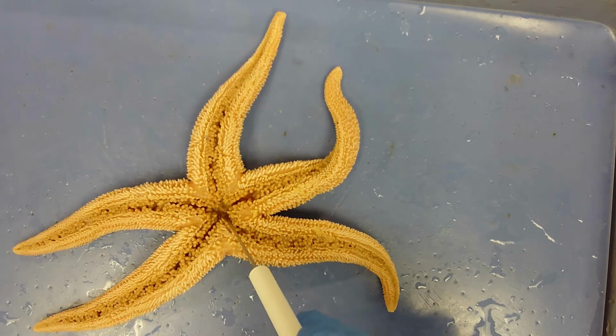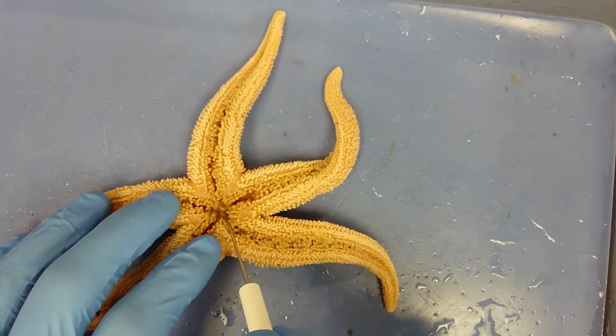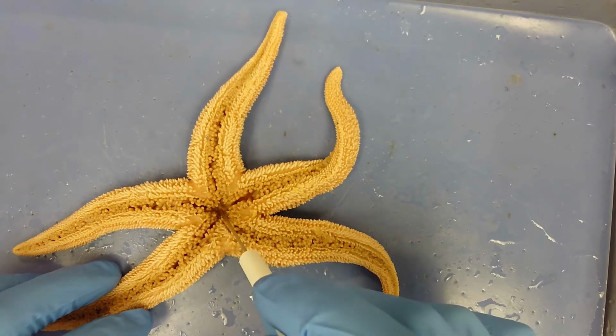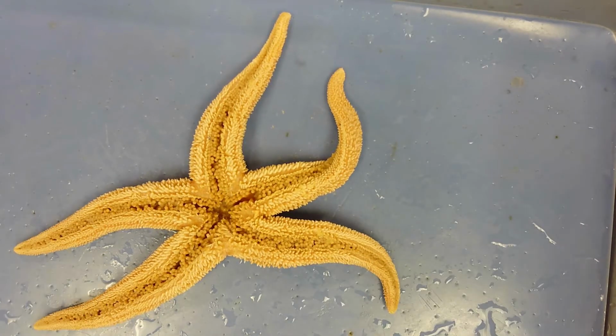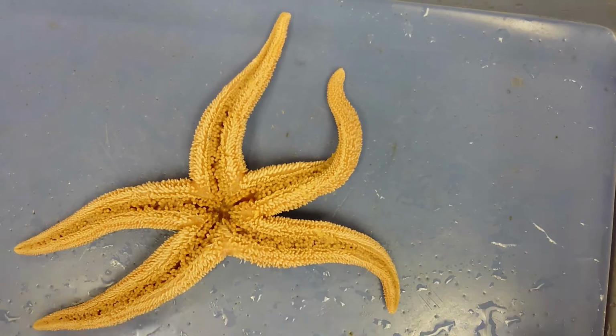This mouth is centrally located, right where all these arms connect, and all food items are going to be entering the digestive system through this mouth. If this sea star decides to eat a fairly large prey item, it'll spit out its cardiac stomach through the mouth and envelop the prey item. After a while, once the prey item becomes digested enough and small enough to enter the mouth, it's brought into the mouth from there.